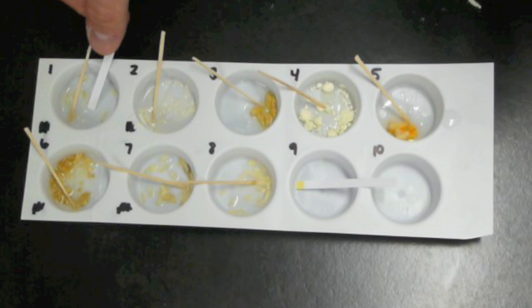What I'm doing now is adding a test strip to each food section, face down so that the yellow part of the test strip is right in the water and food mixture.